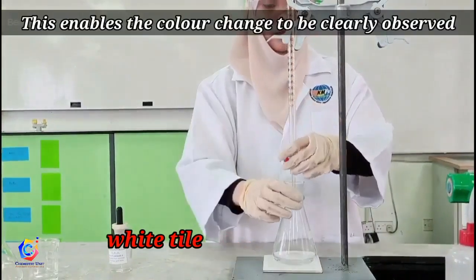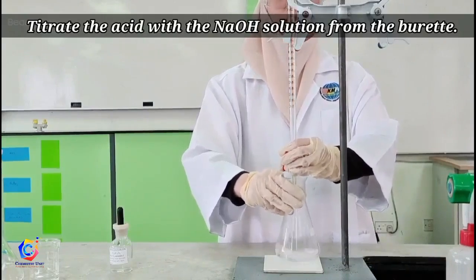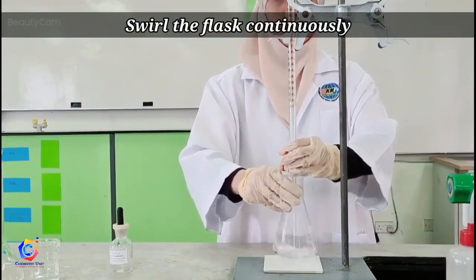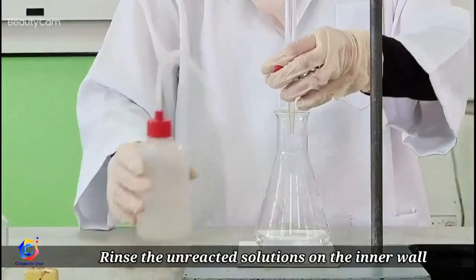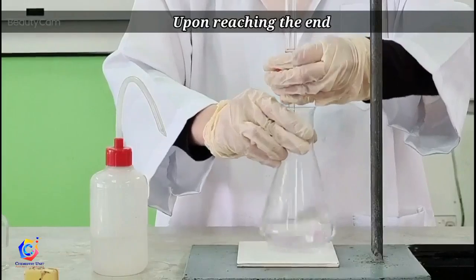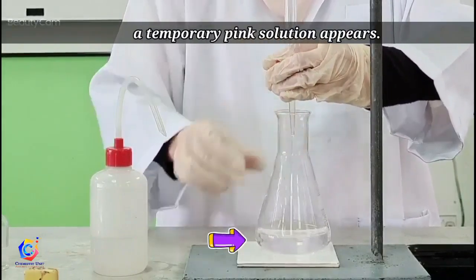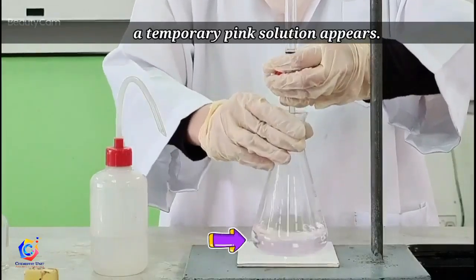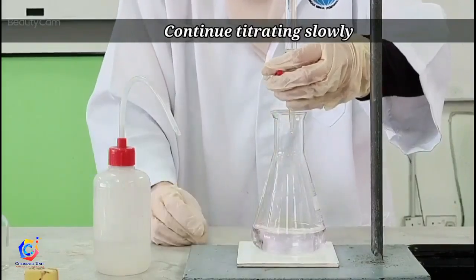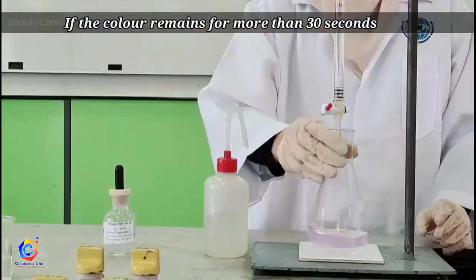Titrate the acid with the sodium hydroxide solution from the burette. Swirl the flask continuously. From time to time, rinse the unreacted solution on the wall of the conical flask and at the tip of the burette. Upon reaching the end point, a temporary pink colour will appear. It fades when the solution is swirled — continue your titration, but now slowly, until a pale pink colour is obtained. If you obtain a pale pink colour that remains for more than 30 seconds, that is your end point.